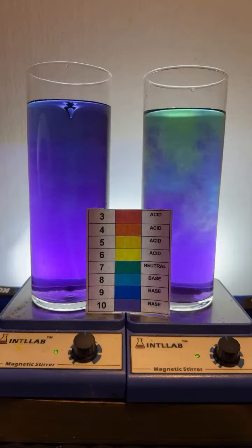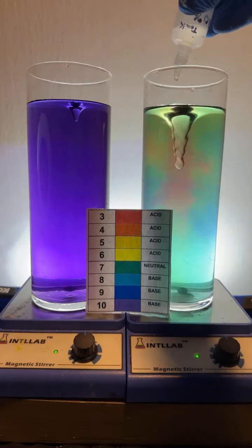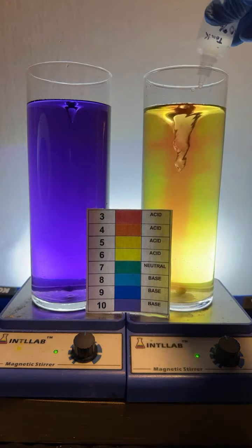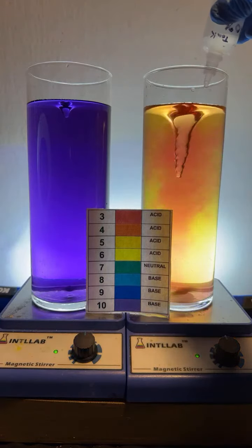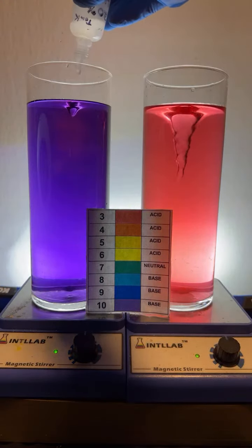Sanskar, I am adding 20% by weight hydrochloric acid or 20% by weight sodium hydroxide. SM, I do not dispose of the fluid. I don't need to. All I need to do, here, I'll show you what I do. I make sure that the solution is acidic because I notice that mold does not grow in these solutions if they are acidic. So I get the pH at about 3. And then I just save the solutions for the next time I do the live.